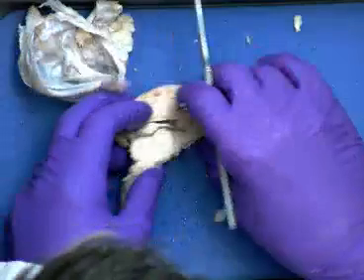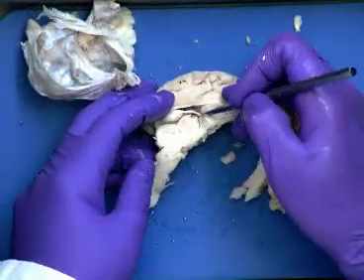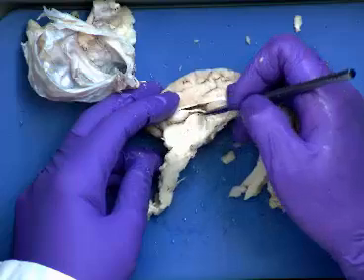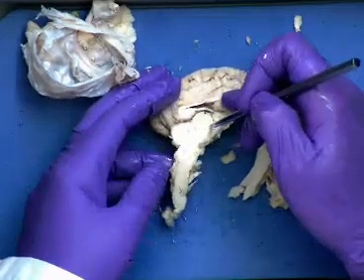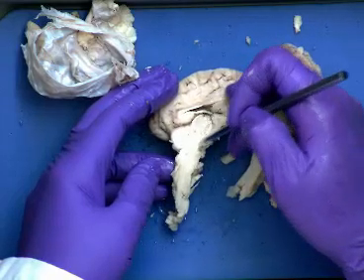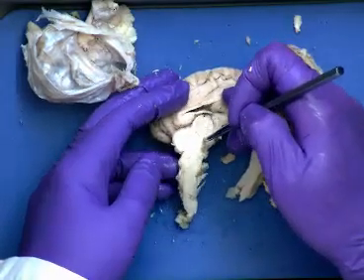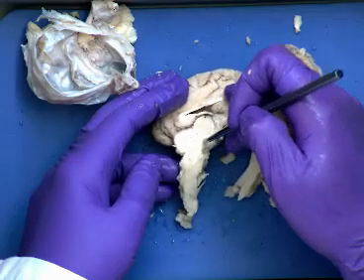Sometimes, depending on the cut, looks like I was a little off, we know that our third ventricle is going to be here, in between the 2 halves of the thalamus. And sometimes you can actually see the cerebral aqueduct coming down and going into the spinal cord. So when you do your mid-sagittal cut, if you do it right in the middle, you should see a little groove coming down here.